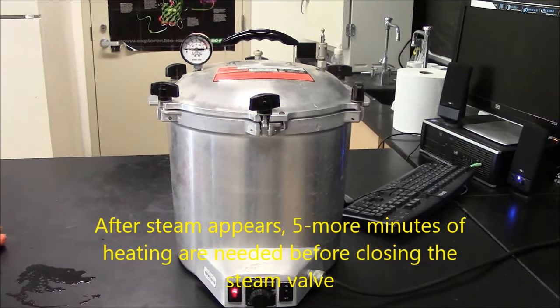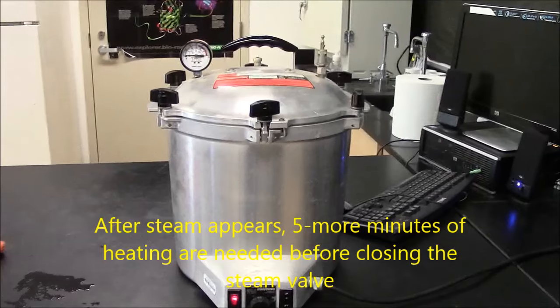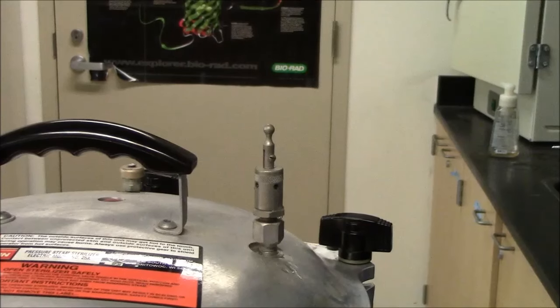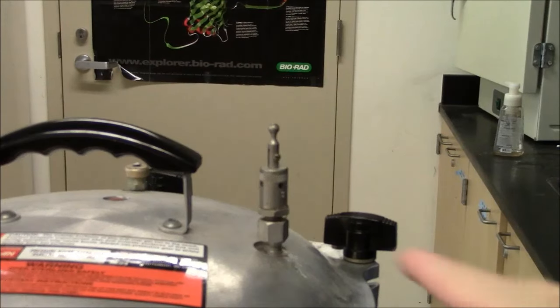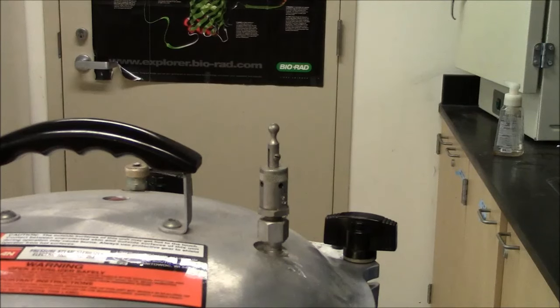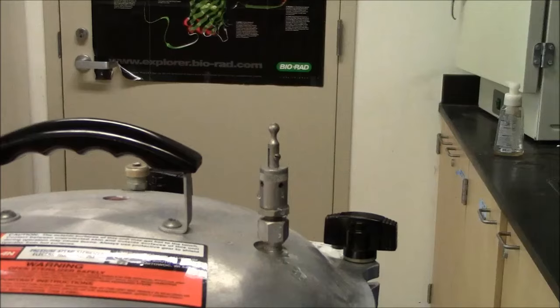Now steam is appearing at the valve. You can hear the hissing. You can see some droplets of water being expelled by the steam pressure. So I have to let this happen for just a couple more minutes. Five minutes total of steam escaping is recommended.